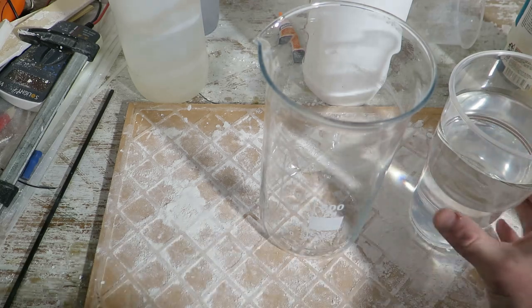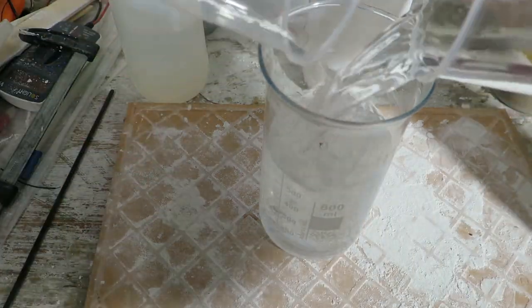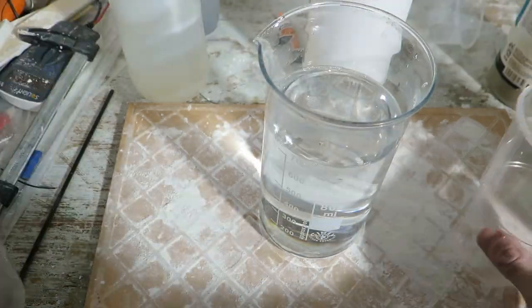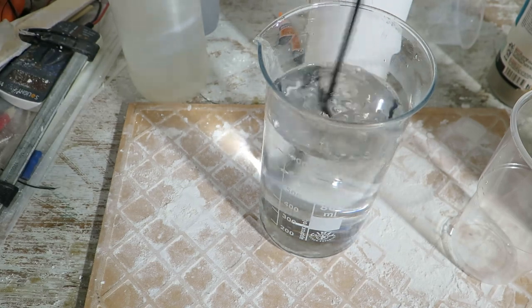After some time, depending on the ratio that you got, the solution will start to get cloudy. I always try to get as neutral solution as possible. With small excess of sodium silicate, the solution will turn into the gel very quickly.